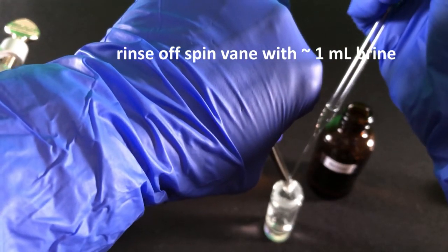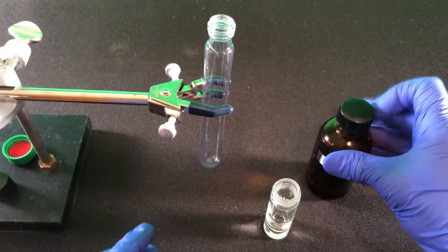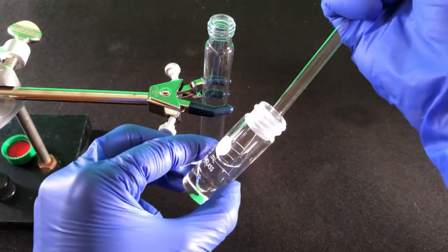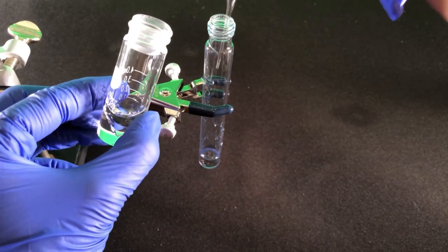Brine is saturated aqueous sodium chloride. This will remove any residual reaction mixture on the spin vane and also increase the volume of the aqueous layer. Transfer the reaction mixture to a screw-capped test tube using a disposable Pasteur pipette.